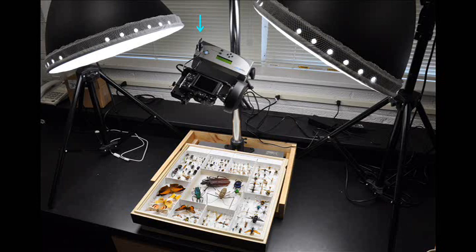If you purchase the GigaPan EPIC Pro model, an AC adapter is provided. However, all other models are only equipped to use batteries from the factory. We retrofitted an adapter into the EPIC 100, and there is a link in the video description for how to incorporate one. The adapter for the camera was purchased from Canon.